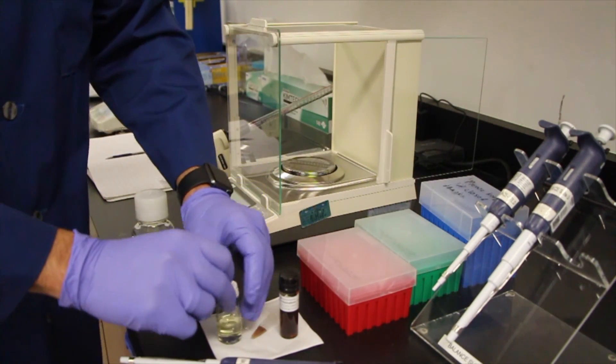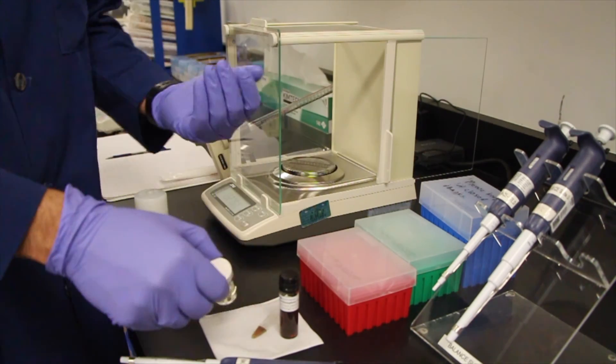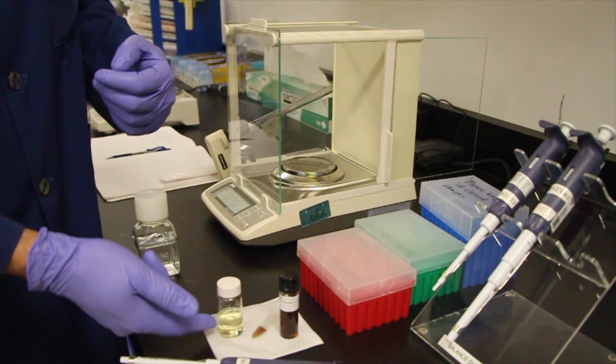And now you're pretty much ready to measure it on the UV-Vis spectrophotometer. Once again you'll blank it and then you'll use the solution directly for the measurement.